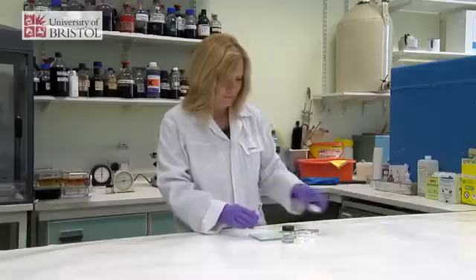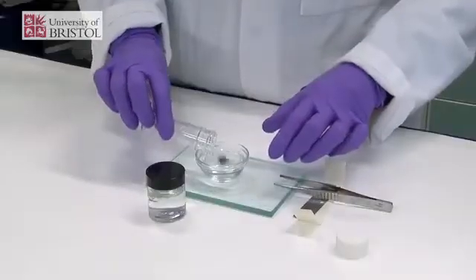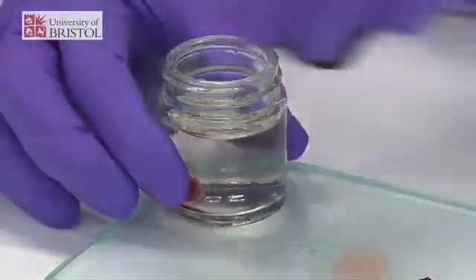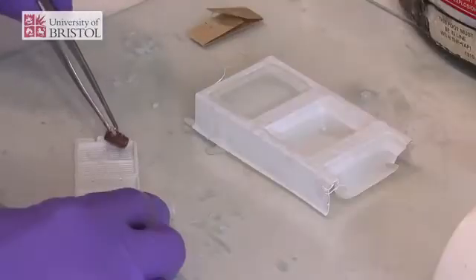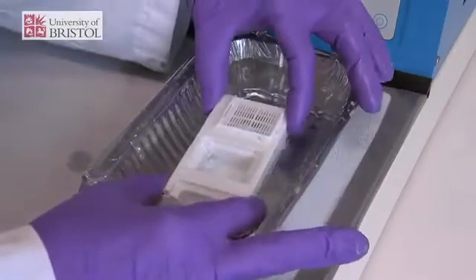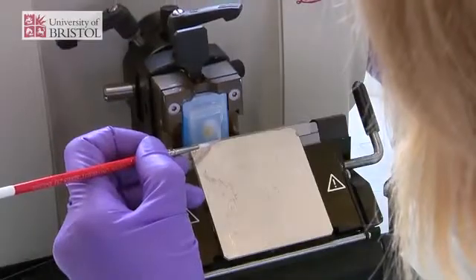In histology we need to preserve a tissue by fixing it, to keep it in as lifelike a state as possible and also to prevent it from degrading. The tissue is processed and embedded in wax, and the wax provides some stability to the section and protects it, enabling us to cut very thin sections of the tissue without damaging it.